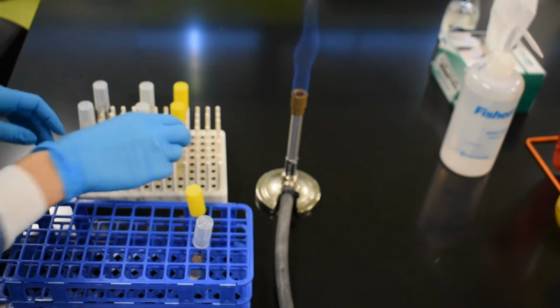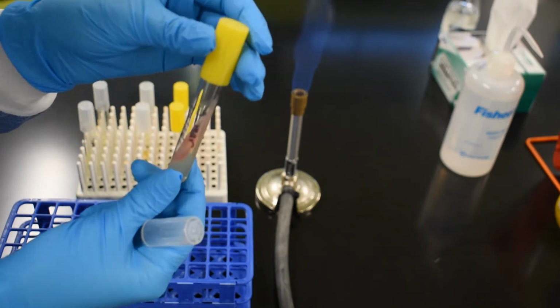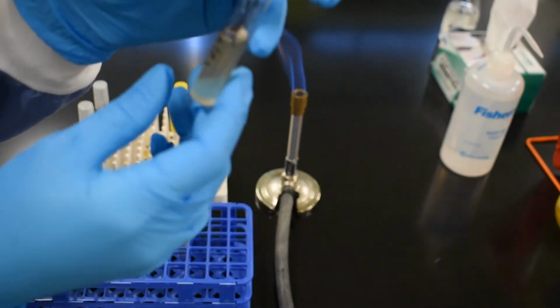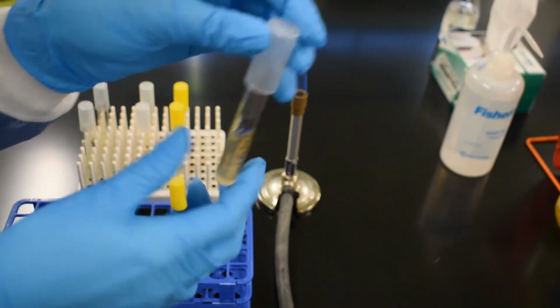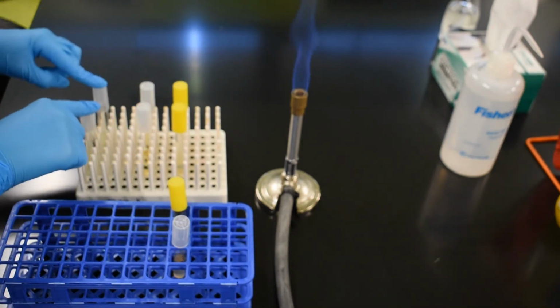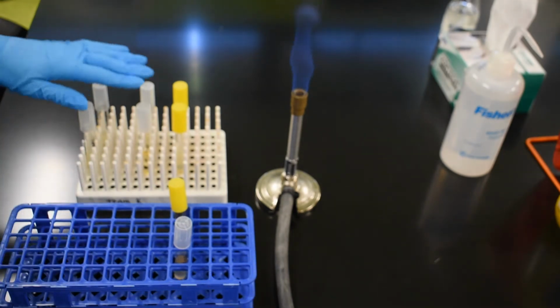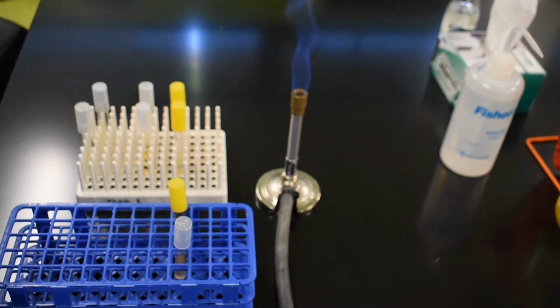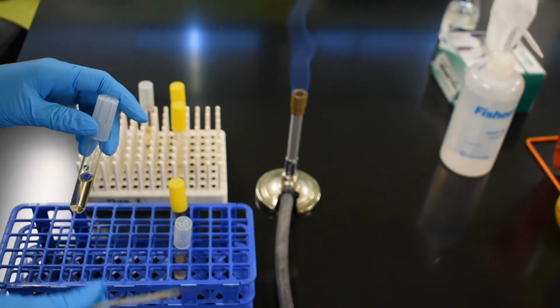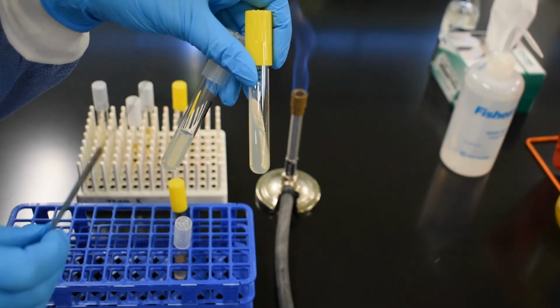For our stock cultures, we have 2 tubes of Serratia marcescens. This one is a stock culture grown on a slant. This one is a stock culture grown in a broth tube. We are going to be transferring each of these into one of the 3 different types of media. The inoculation tool that you use depends upon which type of media you are transferring into. If you are transferring into a fresh broth tube, you want to use the loop. If you are transferring to a fresh slant or fresh deep tube, you want to use the needle.